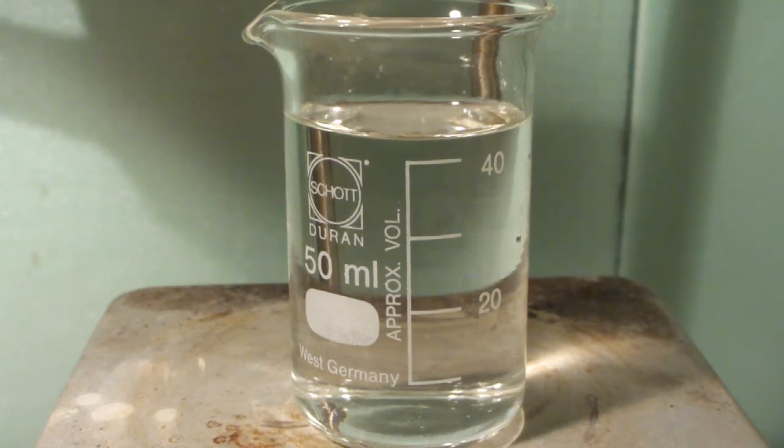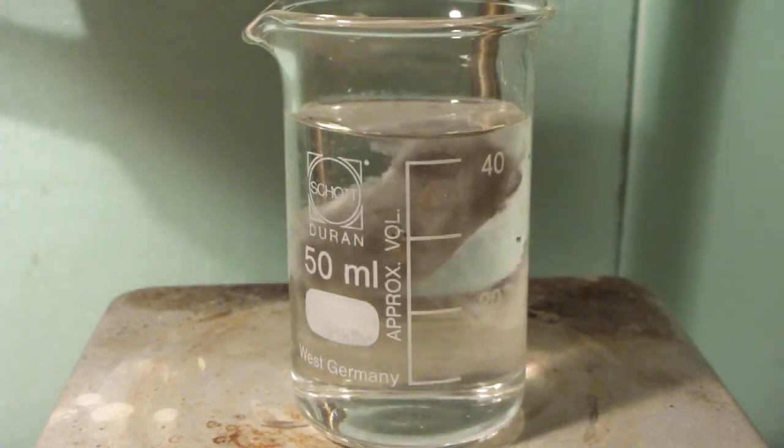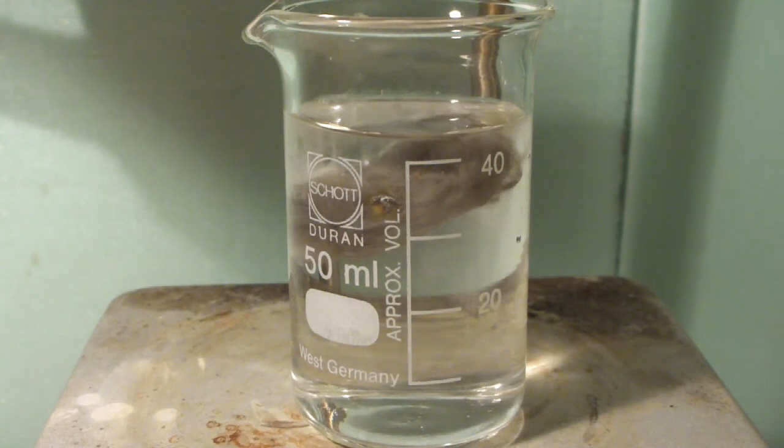Then, we first add our fused silica substrate platinum catalyst to the hydrogen peroxide. You'll immediately see bubbles of oxygen as the hydrogen peroxide is decomposed.